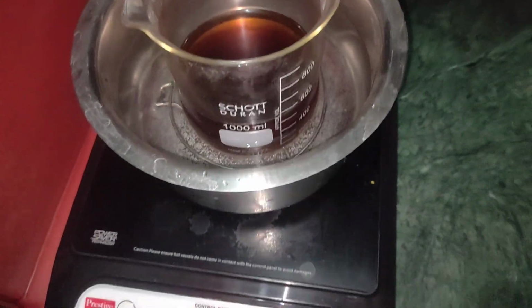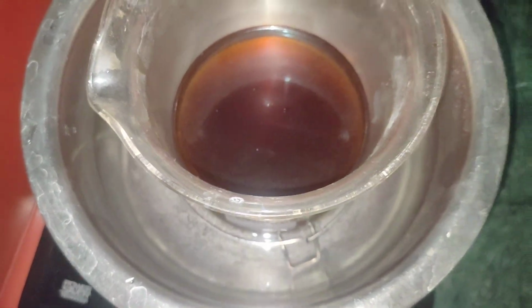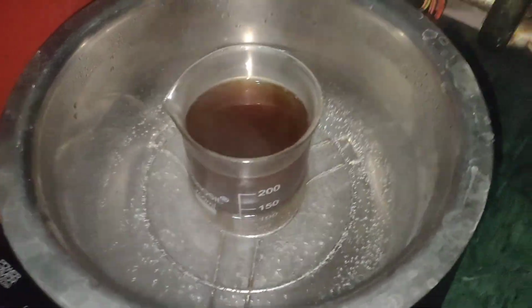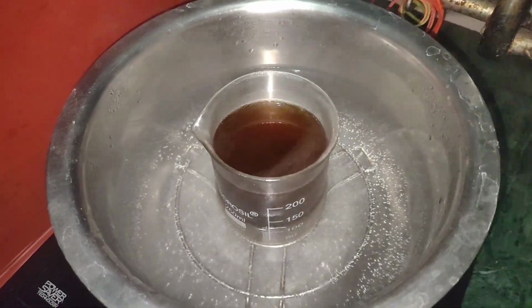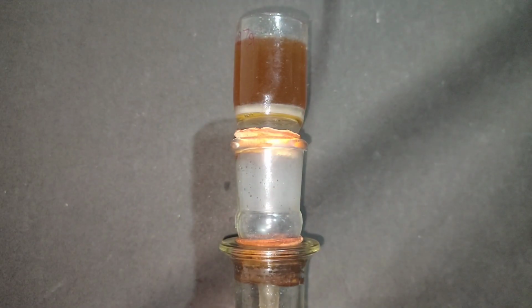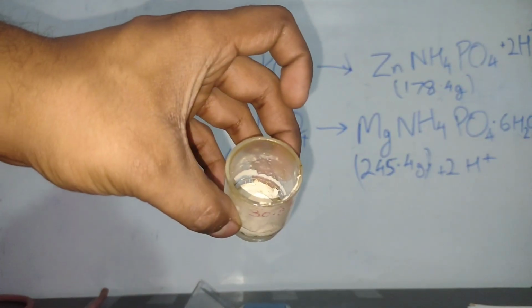Now we have to digest the precipitate. So to digest the precipitate, I placed both the beakers on a boiling water bath and then cooled them. By this method we digest the precipitate. What happens in digestion is that the small particles coagulate to form bigger particles. Now both the precipitates were filtered by a sintered glass crucible which was pre-weighed. You can see these are the reactions of the precipitation method that I have used.